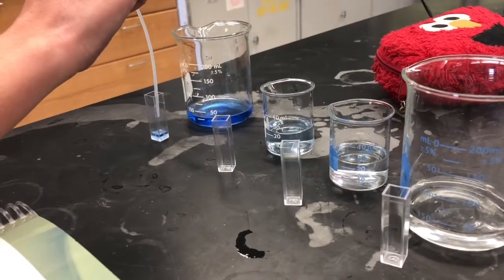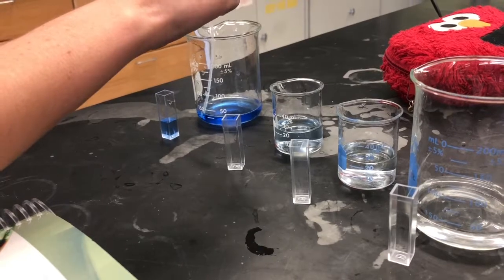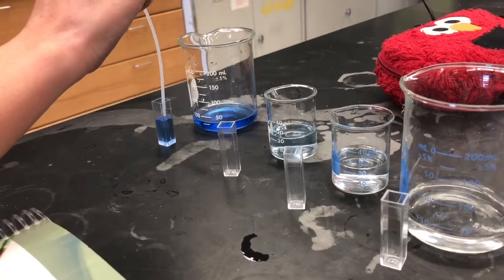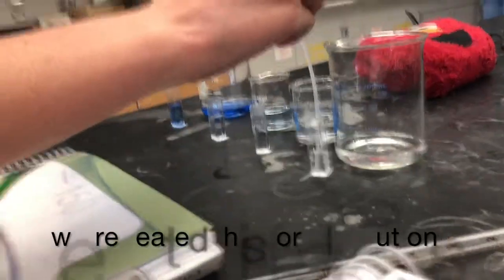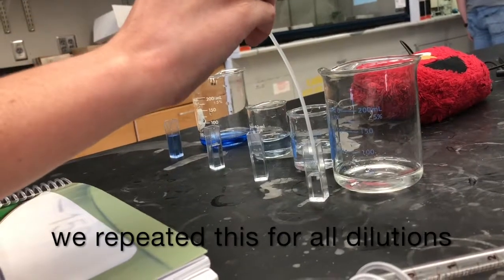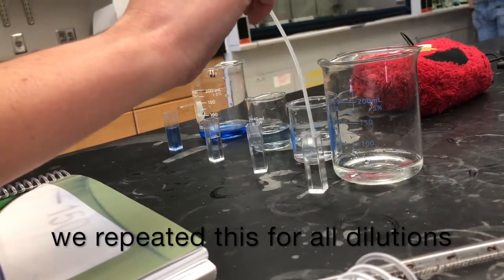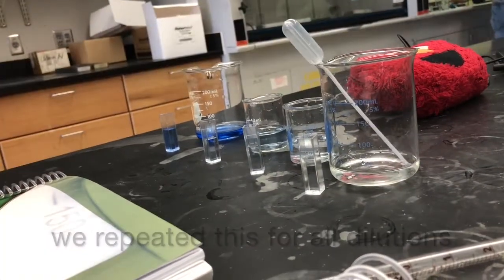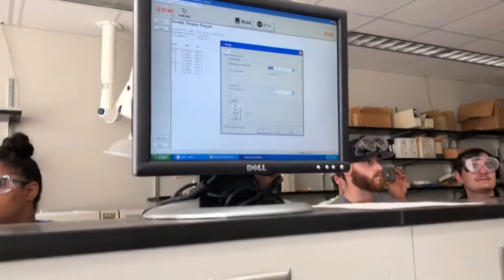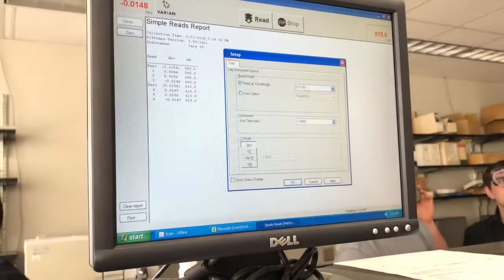After making our dilutions, we transferred some of the stock and the dilution solutions using a pipette into the cuvettes, making sure not to fill the cuvette more than 3/4 full with any solution. It is also important to zero the spectrophotometer to zero out any light absorbed by anything in the solution other than the compound of interest.